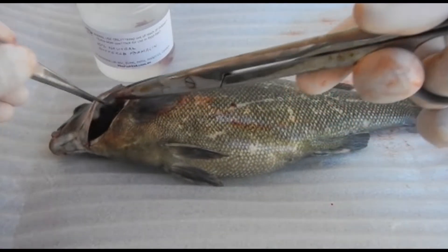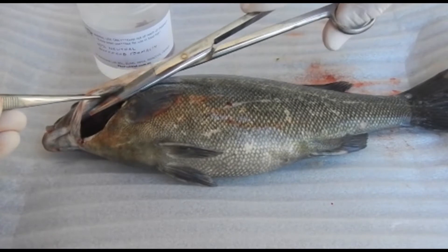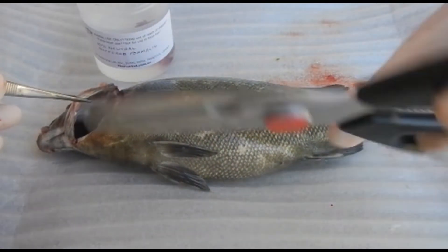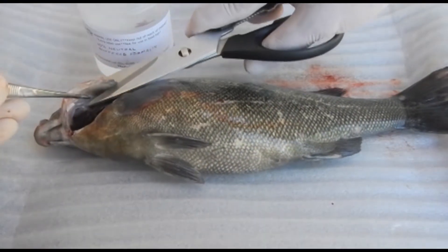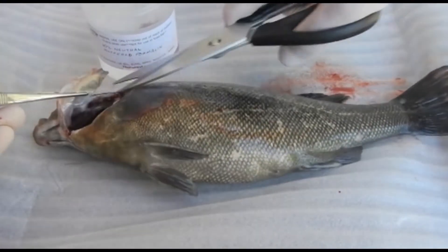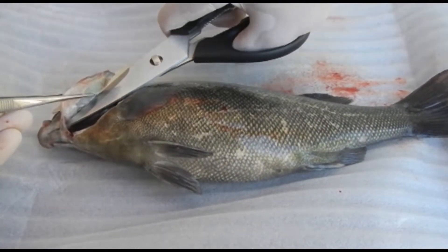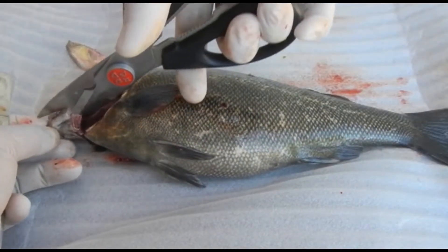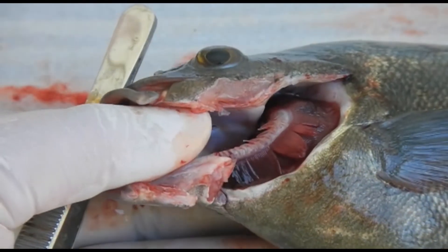To get into the oral cavity to examine it, you first remove the gill cover, also called the operculum, which is a bony plate that helps with pumping water through the buccal cavity. I'm using a larger pair of scissors, which is helpful to cut through bony structures, and then we put the final cut through to the front of the mouth.